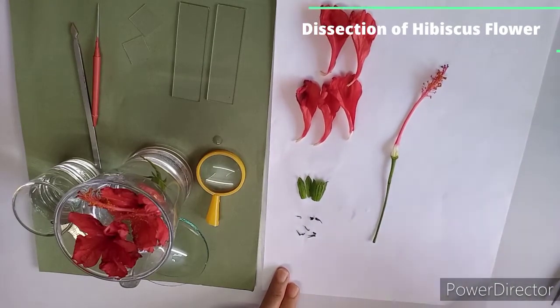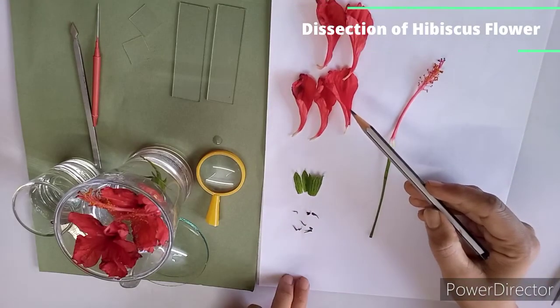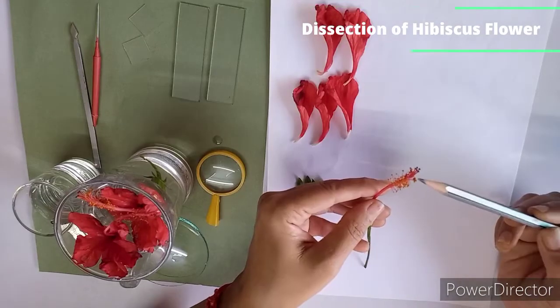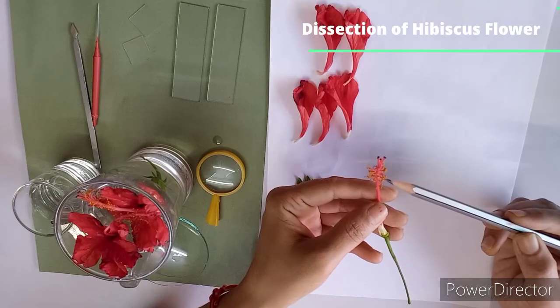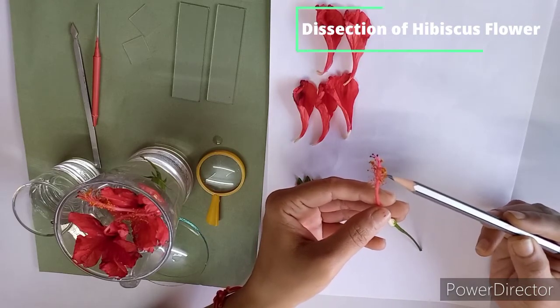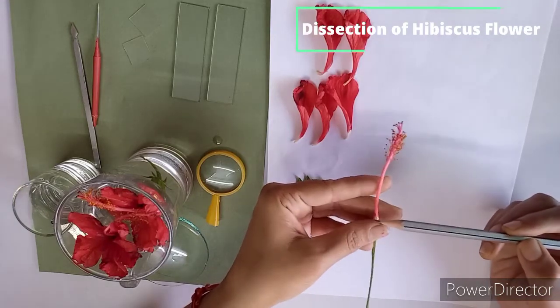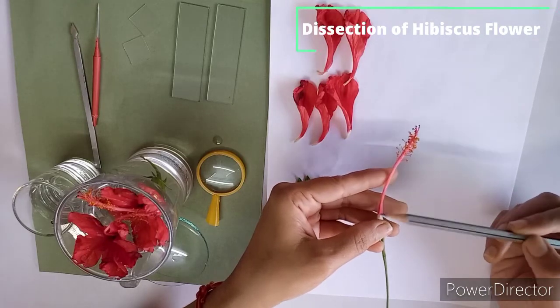So you can observe here, this is my epicalyx, this is my calyx, and this is my corolla. And here now I am going to dissect the gynoecium part. Here you can observe this is the stigma, yes, and these are the anthers. And on the anther, here you can see these are the anther lobes, yes, which are connected by the connectives, and inside this structure we are going to dissect the gynoecium part. So let's start to dissect the gynoecium part.